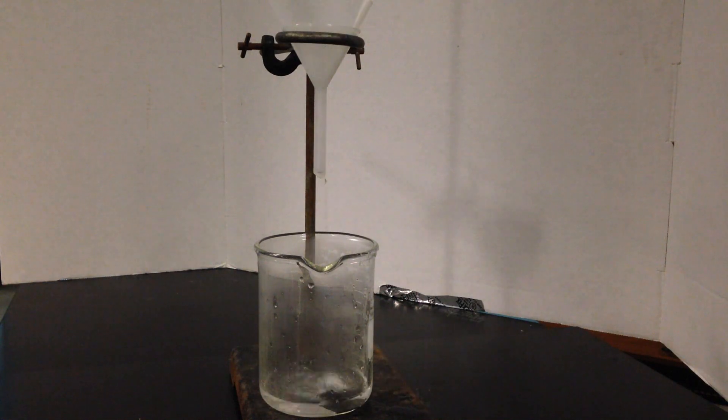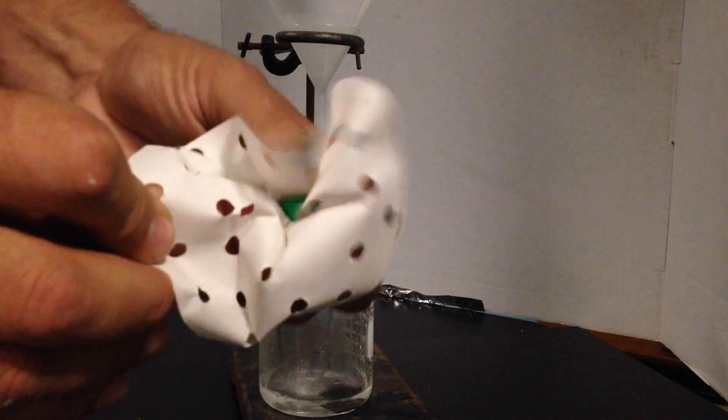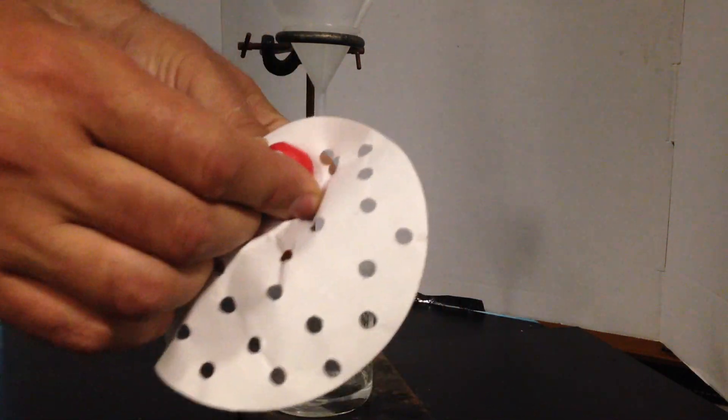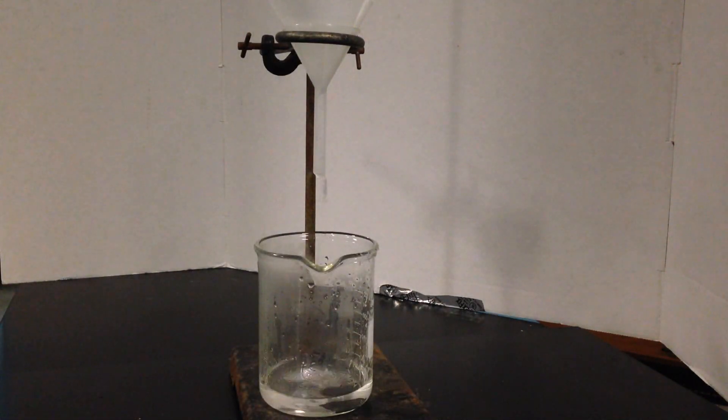What's coming through here? Just the water, water and the individual ions from the salt. They're going right through because they're just as small. The reason why I heat it is because it takes some time to get through the filter paper. As I'll show you in a second, there's no salt being collected. You can't filter out a solution even though it's a physical separation. The size of the individual particles are too small; they're going to go right through my filter paper. We're not going to see any solids appearing.